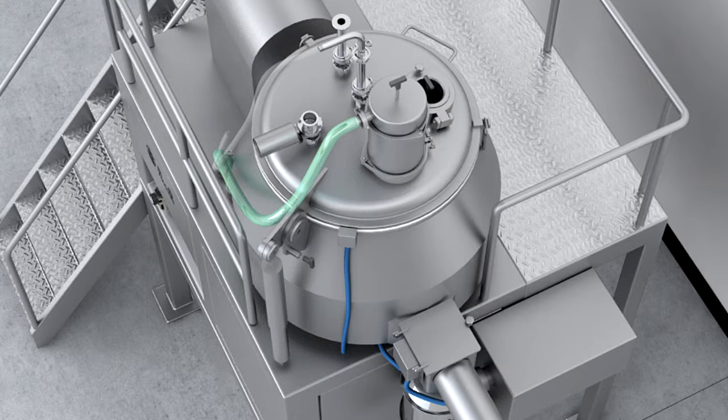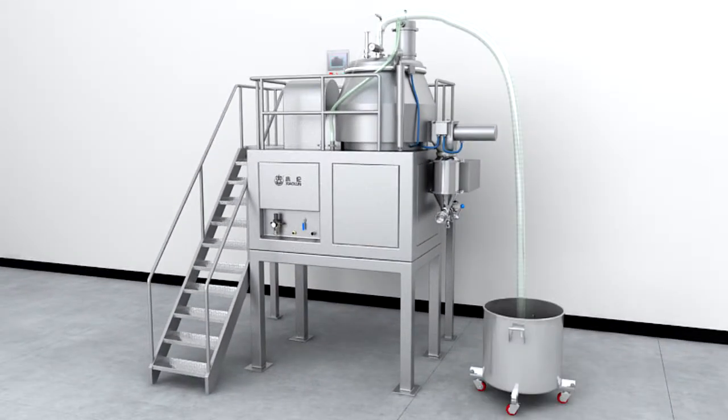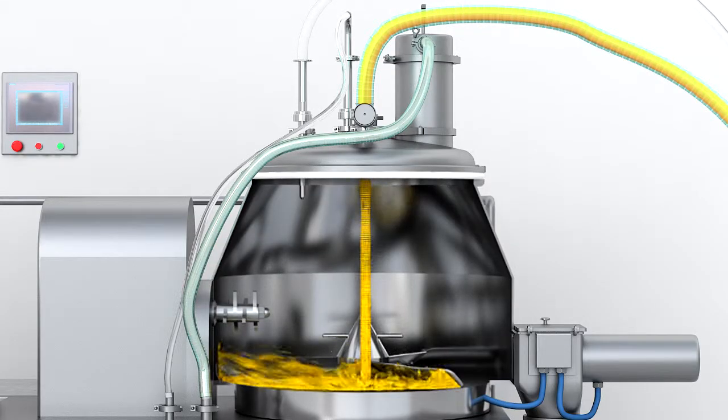The equipment is designed with a self-vent vacuum loading function. The material container is vacuumized by a vacuum source through the vacuum filter on the top of the lid. The materials will be sucked into the container via the loading valve and pipe under the force of negative pressure.